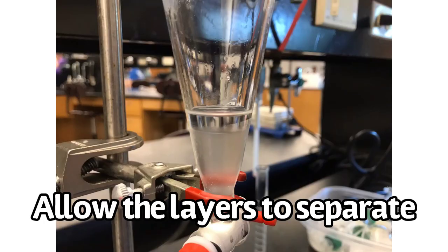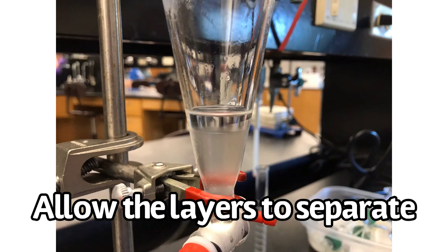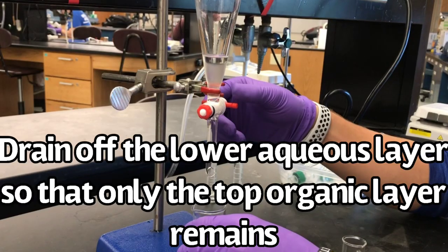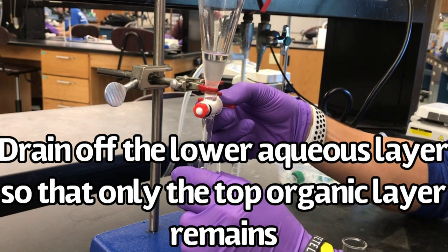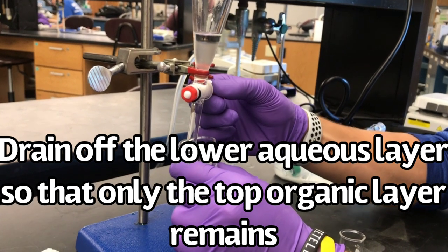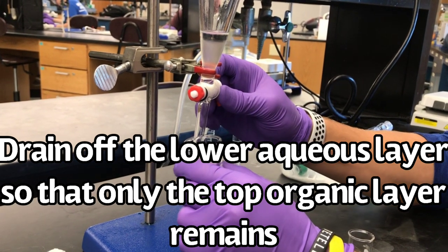After swirling, allow the layers to separate completely. Drain off the lower aqueous layer so that only the top organic layer remains in the separatory funnel.